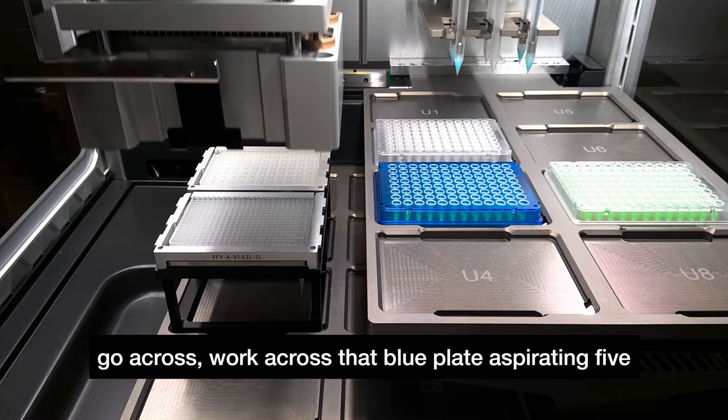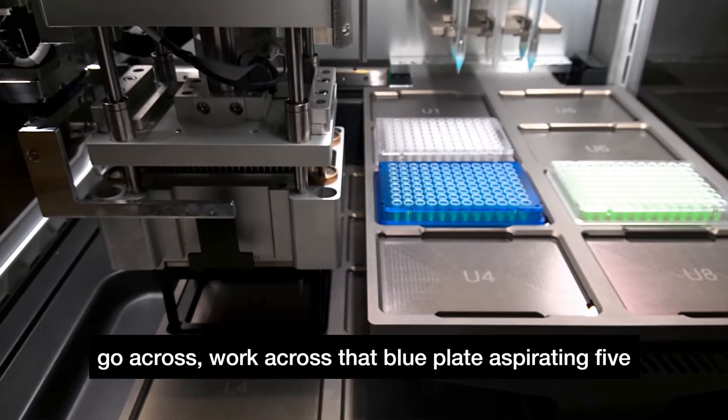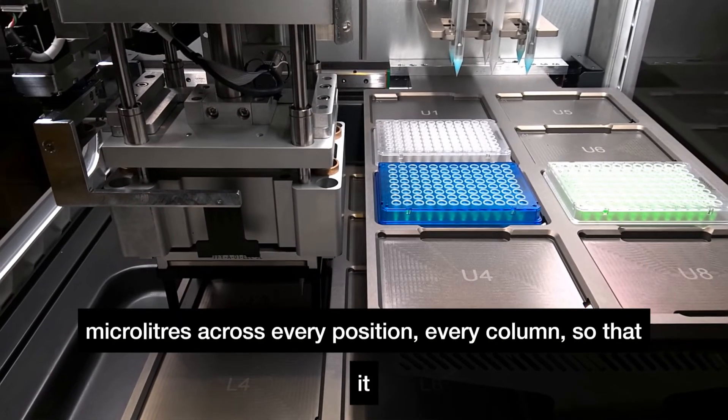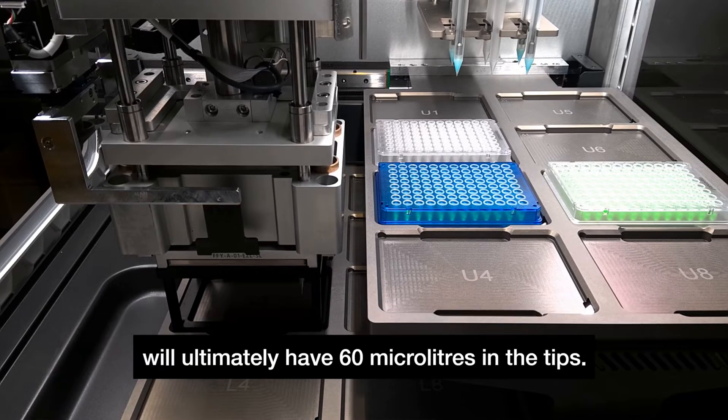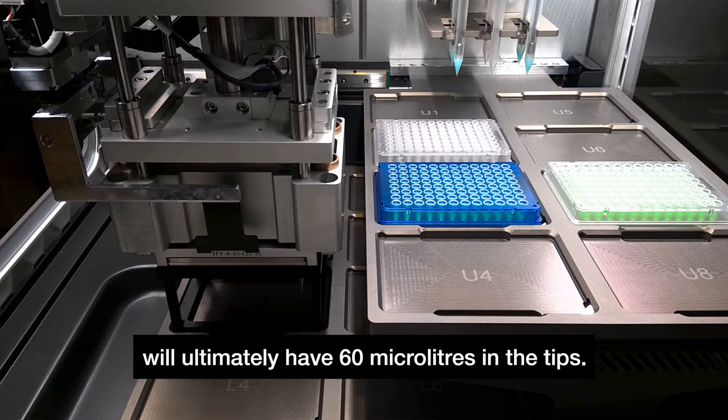It will work across that blue plate aspirating five microliters from every position, every column so that it will ultimately have 60 microliters in the tips.